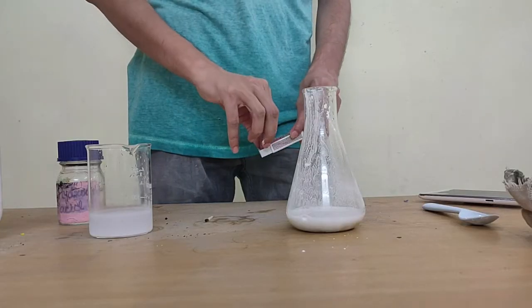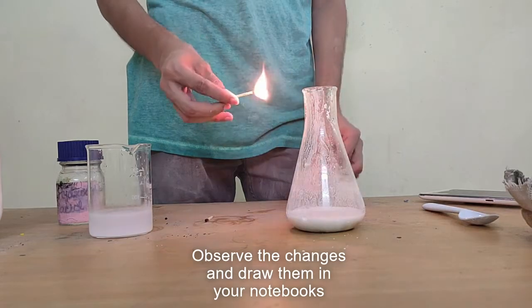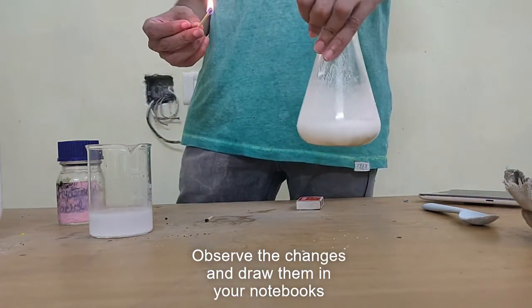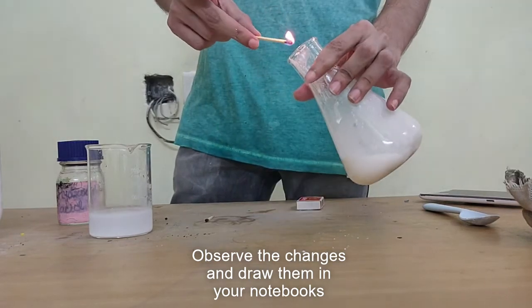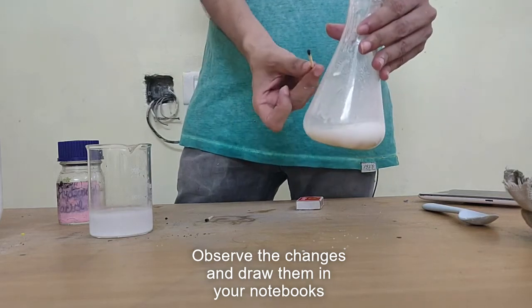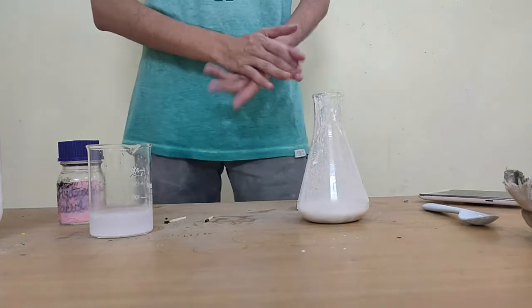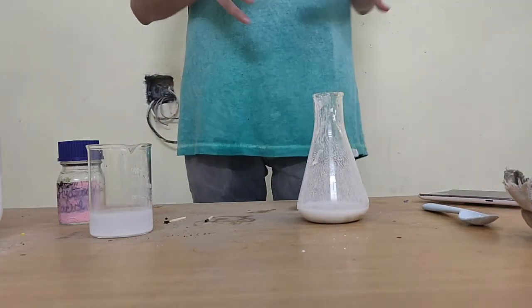We'll just do it again for visual sake, and I'll let the gas collect for a bit, stir it up. There's no reason for it to go off other than because of the gas inside of this, right? So this is the second way to identify when carbon dioxide is being created. It simply goes off without a sound.